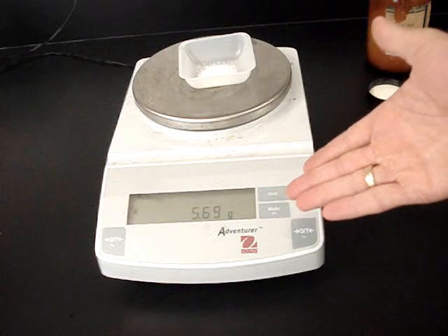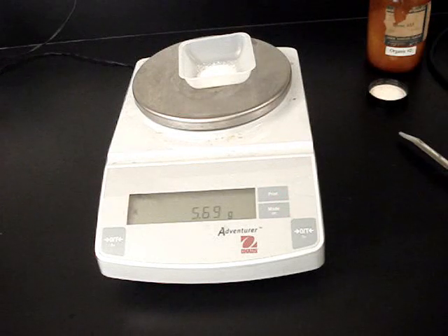And the mass that it's giving me now, 5.69 grams, is simply the mass of the sugar.